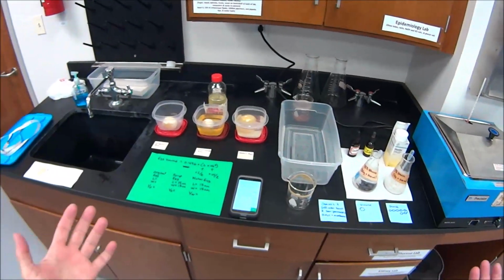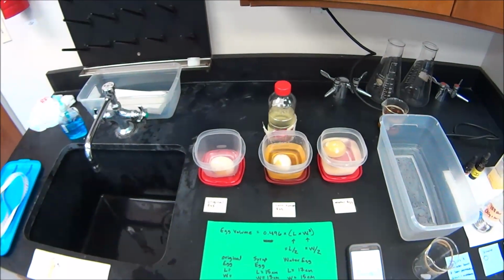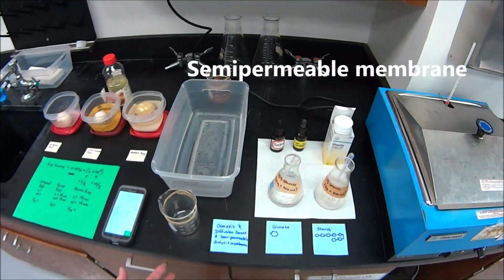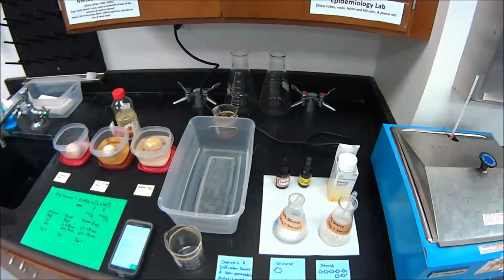Welcome to the Osmosis and Diffusion Laboratory Experiment. We have two experiments that we're going to run today. We have the egg and osmosis experiment, and we have osmosis and diffusion across a semi-permeable dialysis membrane. Okay, let's start with the osmosis and diffusion across a semi-permeable membrane.